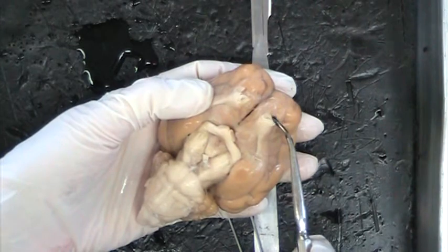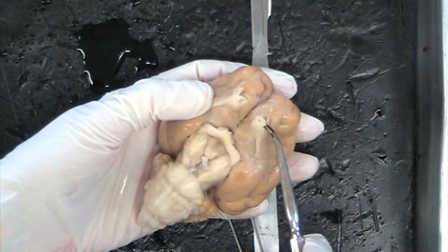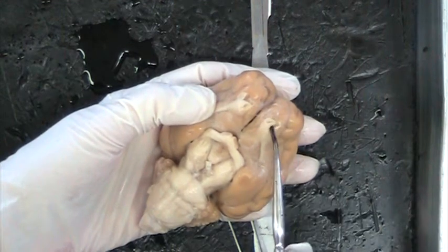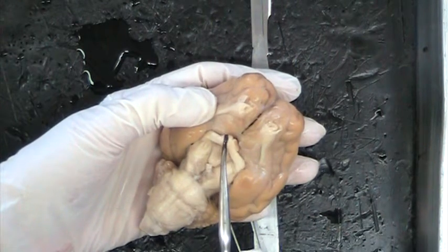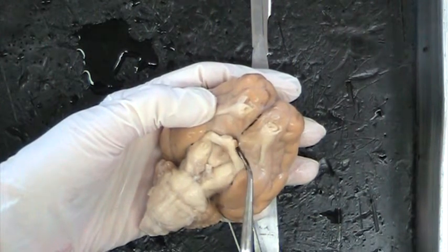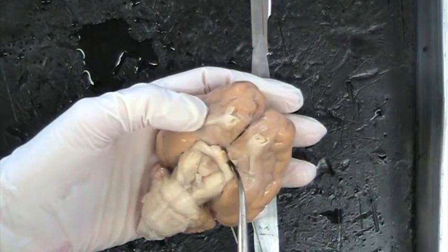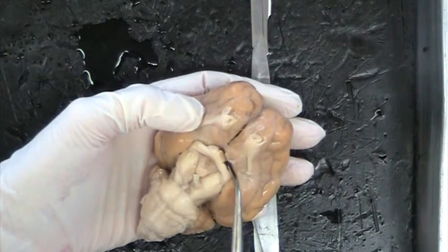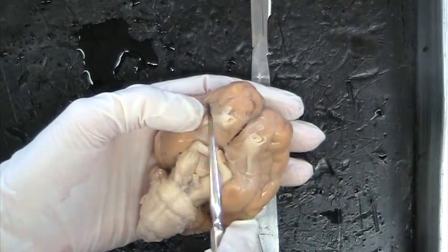So these highest ones out here, the ones that are the longest, are your olfactory nerves. They go all the way out to your nose. Right behind here, and this is usually a U, are the optic nerves to the eye, and they always cut them off. This one's cut off right there, and that one's cut off right there. So the optic nerves, one goes out to this eye, and one goes out to that eye.